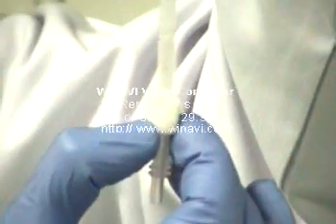This is neutral alumina — it will trap the unreacted fluorine-18. And this is the C18 cartridge; it will take care of the non-polar species like tetra-acetyl FDG. So in multiple steps the purification will be completed.